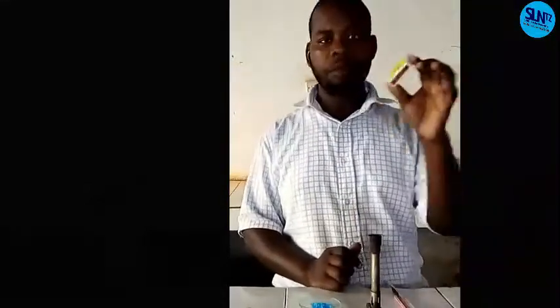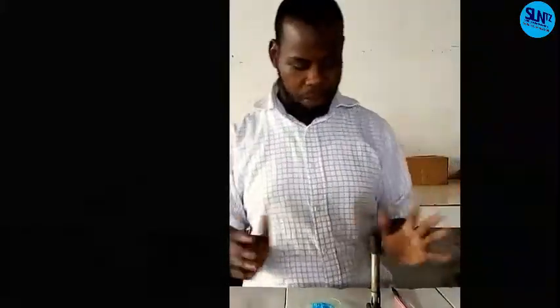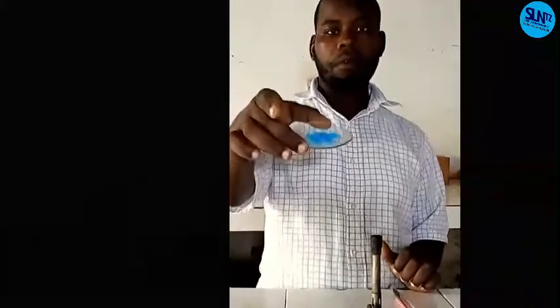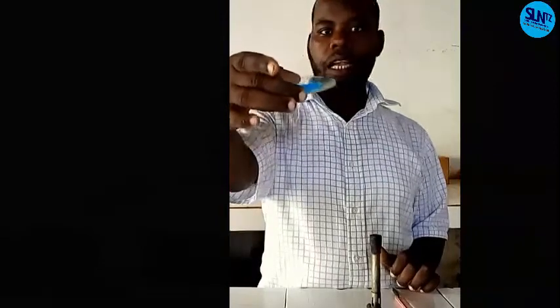Also, I have a flame here, and I have a matchbox. I use a normal matchbox. Let's start our testing of a flame of a salty sample. This is the sample, blue in color, or blue crystals, and this is copper 2 sulphate. So be ready to see observations, to see the steps, and be ready to see the report after this experiment.